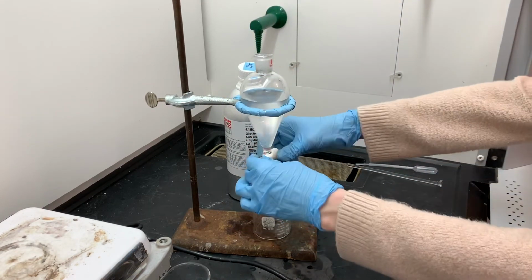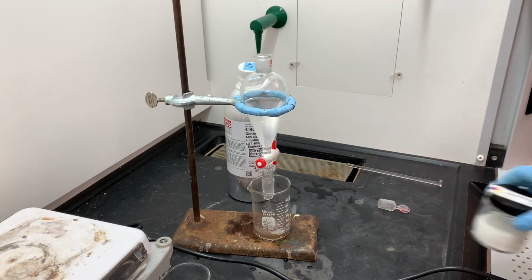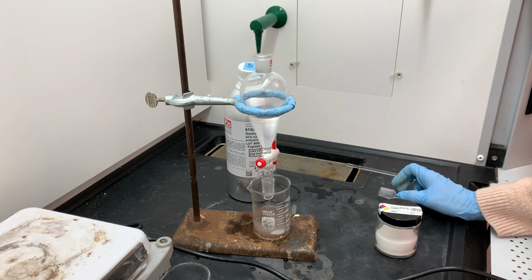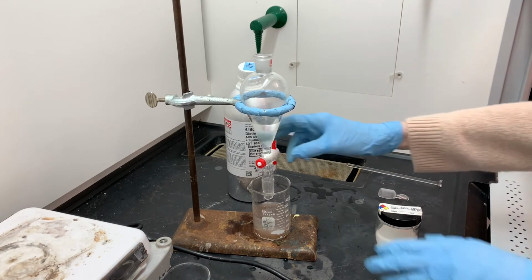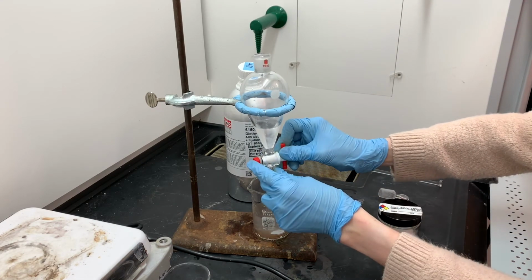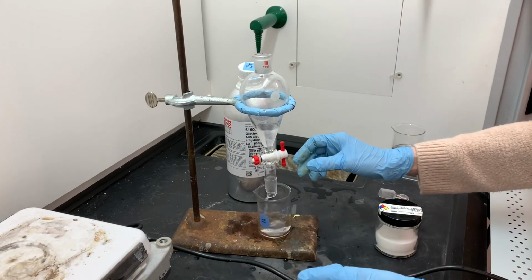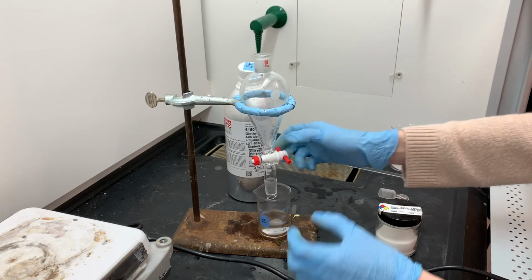Doing extractions with ether and water is a little bit tricky because ether and water are kind of soluble with each other. And so when I get the two ether layers combined, I'm going to have to use a drying agent, this anhydrous sodium sulfate, that white solid that I just put down. I'm going to have to use that anhydrous sodium sulfate to help absorb any trace amounts of water that are in the ether layer. It's going to take quite a bit of the anhydrous sodium sulfate to completely dry, and again, that's just a characteristic of doing an extraction between ether and water.